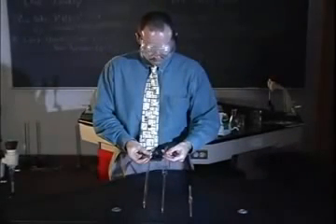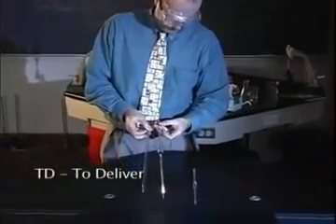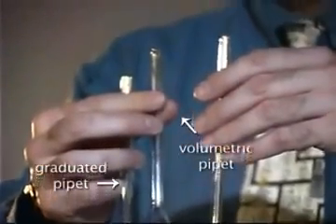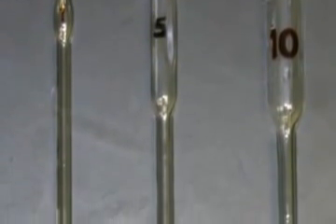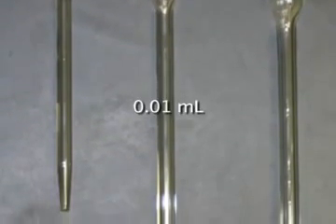The final type of glassware we will describe is the pipette. Pipettes are calibrated TD, to deliver. There are two types of pipettes, graduated or measuring pipettes and volumetric or transfer pipettes. A graduated pipette is read from the top down. This 10 milliliter pipette is calibrated to the tenth of a milliliter, so the volume may be estimated to the hundredth of a milliliter. A volumetric pipette is calibrated for a set volume, 1 milliliter, 5 milliliters, or 10 milliliters, which is indicated on the pipette. These pipettes are precise to the hundredth of a milliliter.